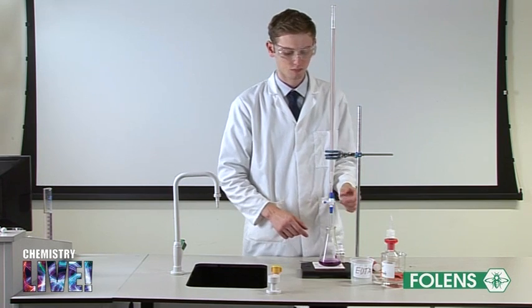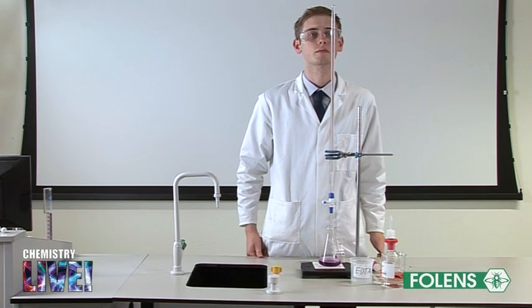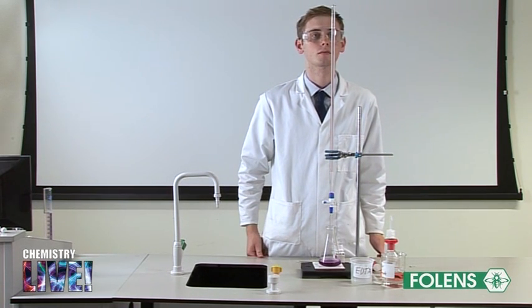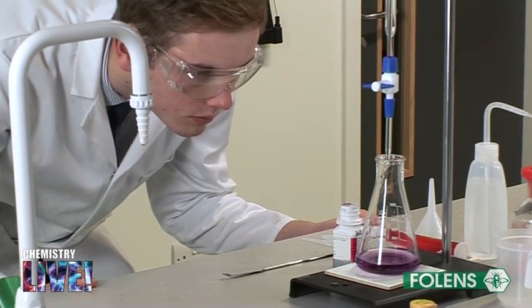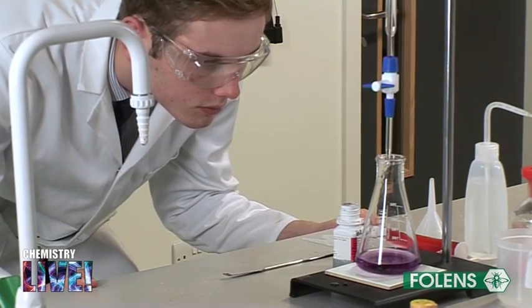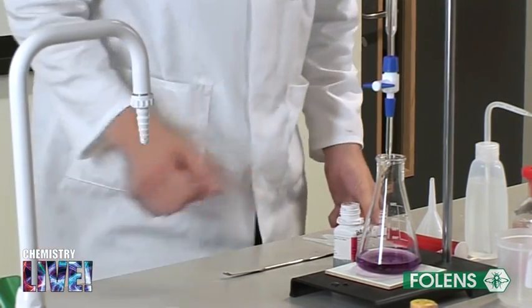The burette has been filled to the mark with EDTA solution and the funnel removed. We have checked that the space below the tap is filled. Note that the color of the solution in the conical flask is wine red.